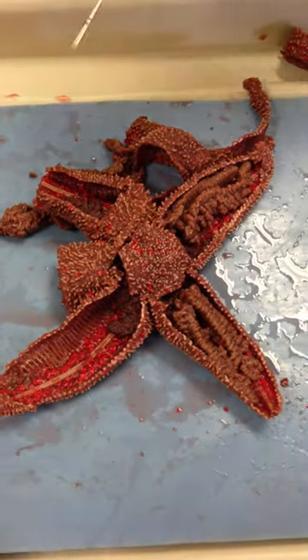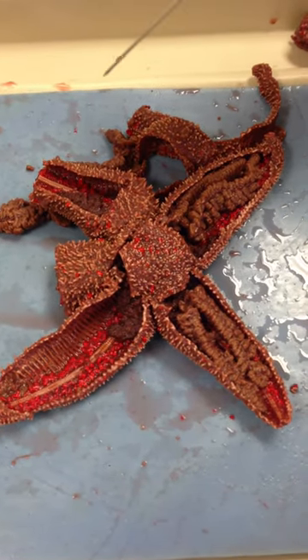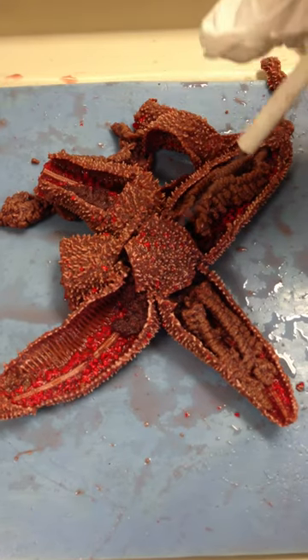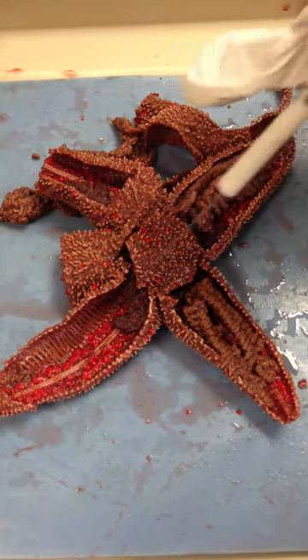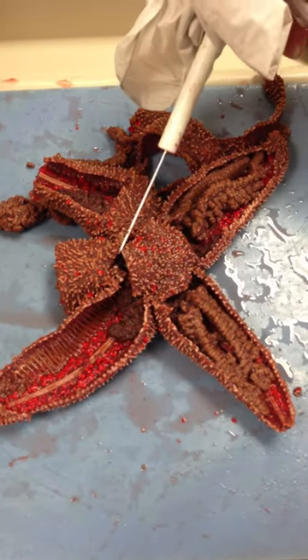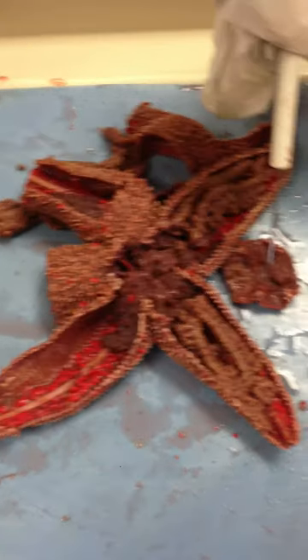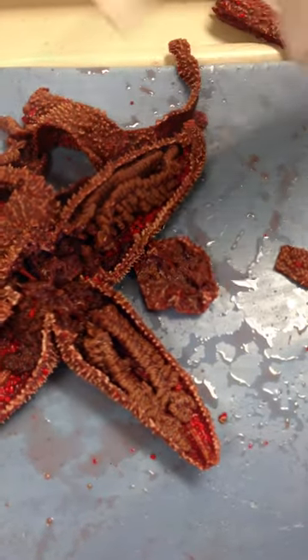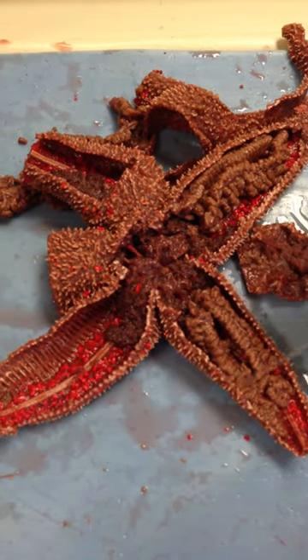We are dissecting a sea star and we're going to look at all the internal organs. We start with the outside, which is going to be the central disc, and a major portion of the digestive area is going to be right here. If we were to remove this particular section, part of our pyloric stomach right here is attached to the top, which is also attached to the pyloric cecum, which is all of this digestive cecum.